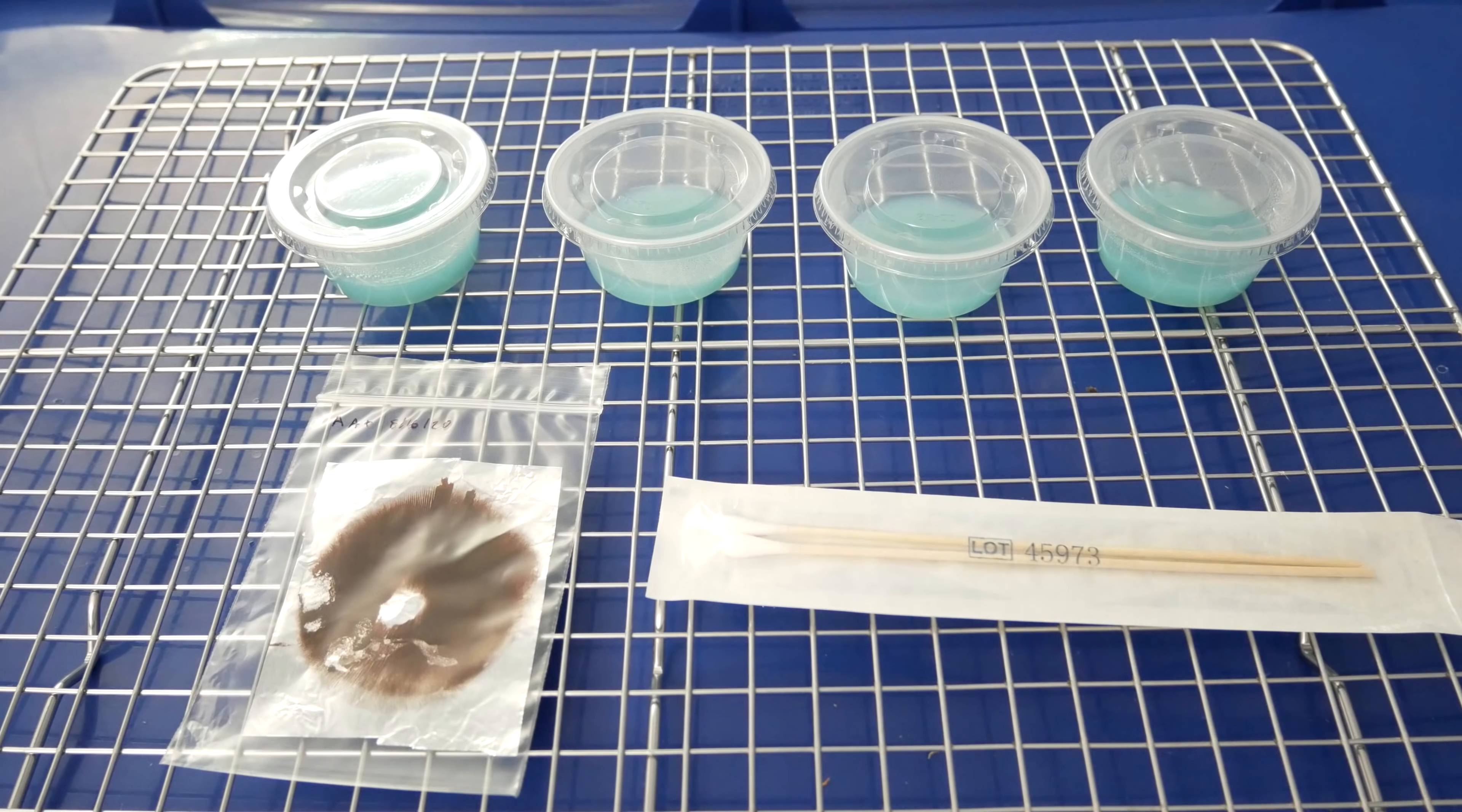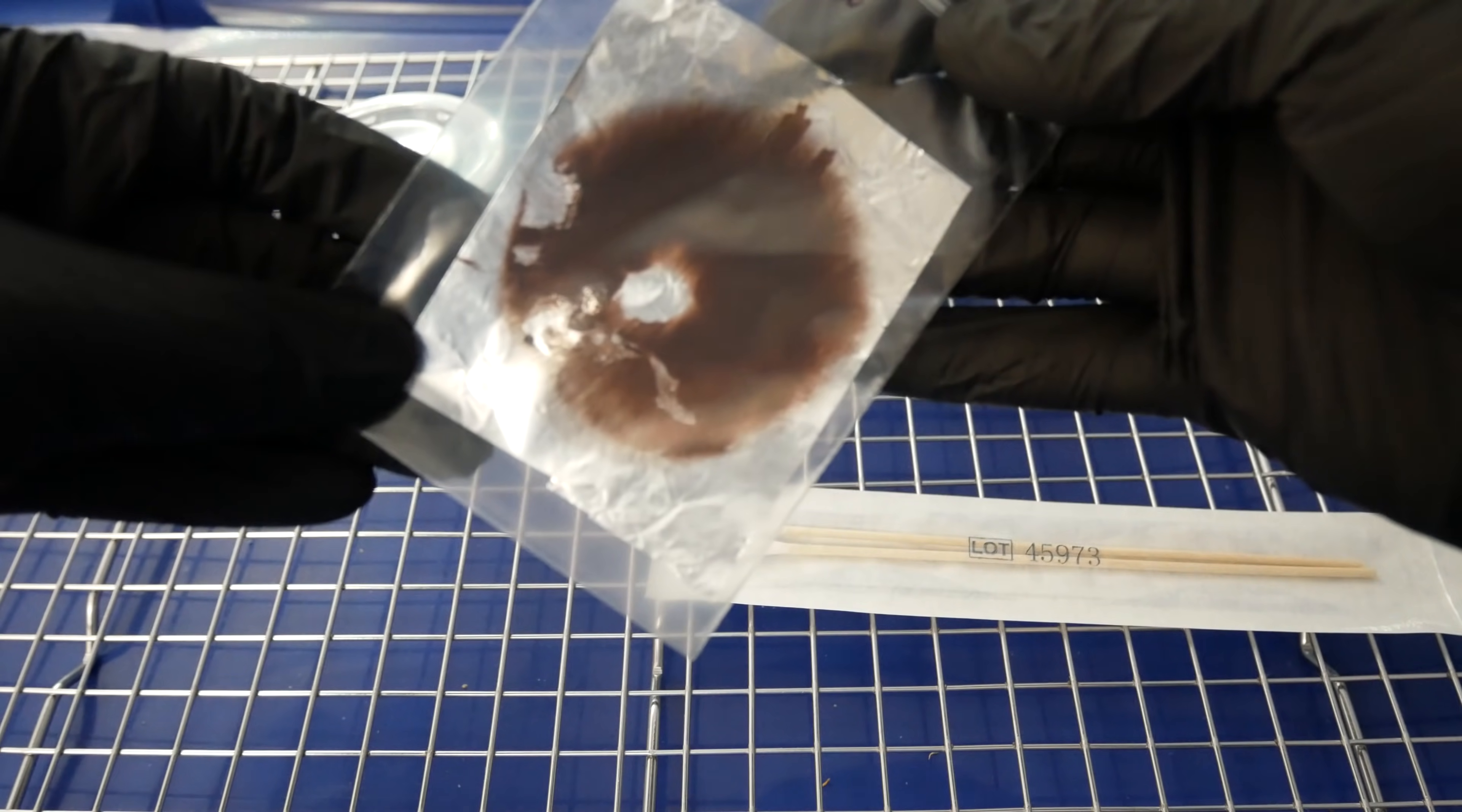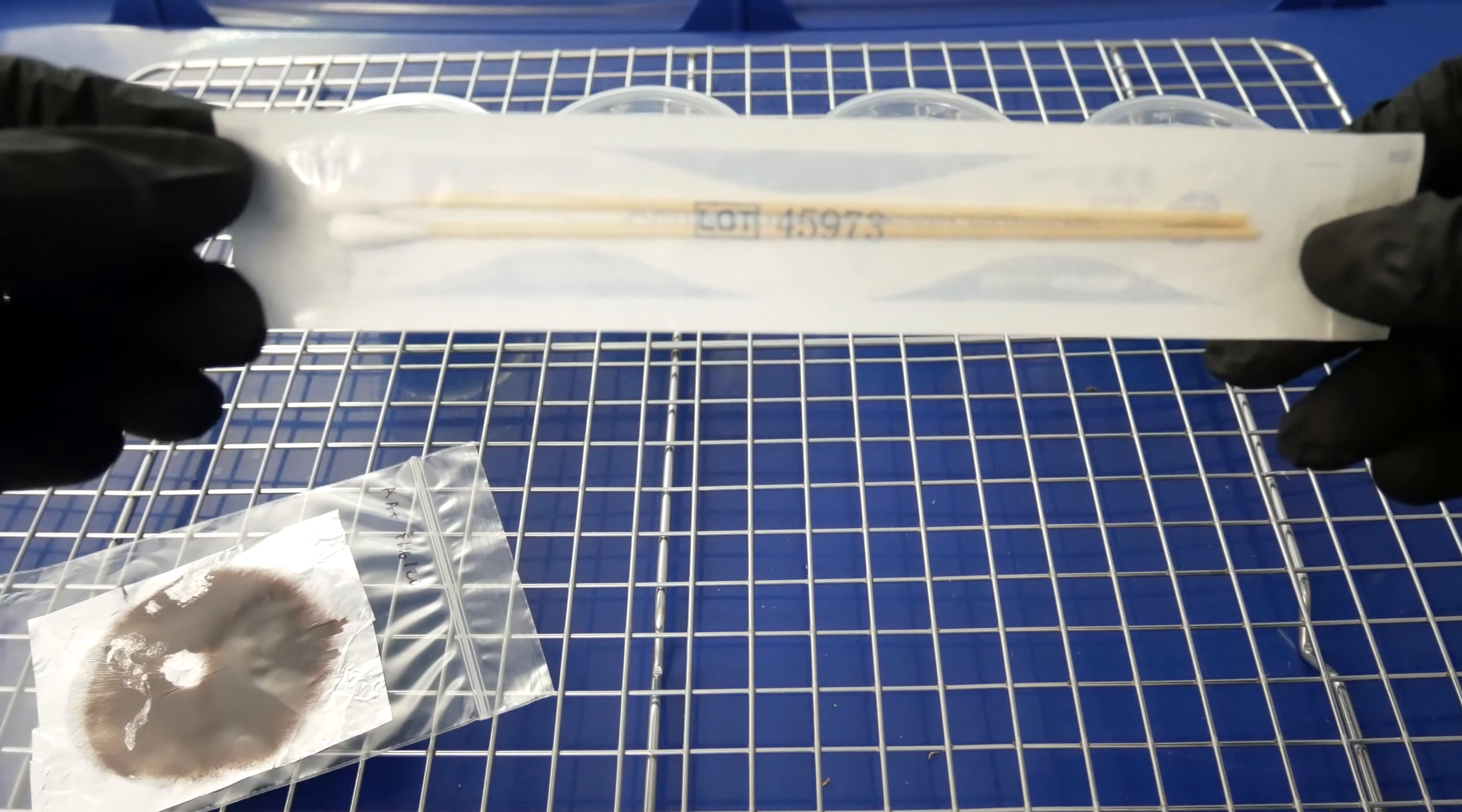In this next example, I'll show you guys how you can use a print to create a swab and germinate it out. I love doing this method because it's going to allow you to stretch a print for many, many grows. You can probably get about 100 uses out of a single spore print by doing this method.